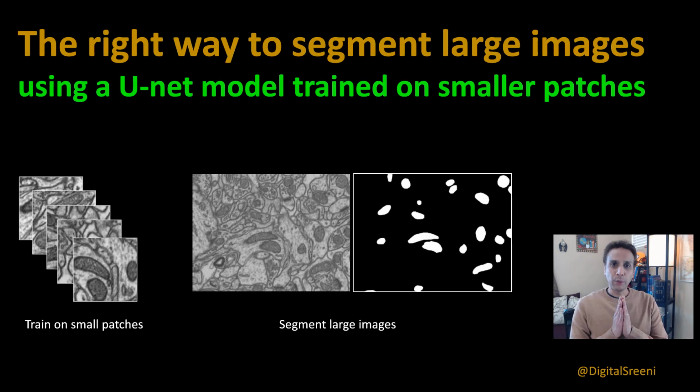Hey guys, welcome back to another video on the topic of U-Nets. If you have watched the last couple of videos, you were introduced to U-Net-based semantic segmentation on this mitochondria dataset that you see on the screen. And in the last video, we actually used watershed to separate any objects that were touching to get accurate object analysis done, right? So this is in a way we performed instance segmentation via semantic segmentation.